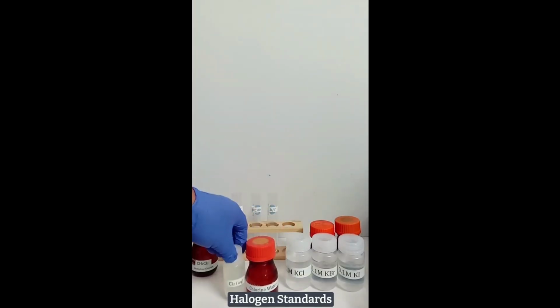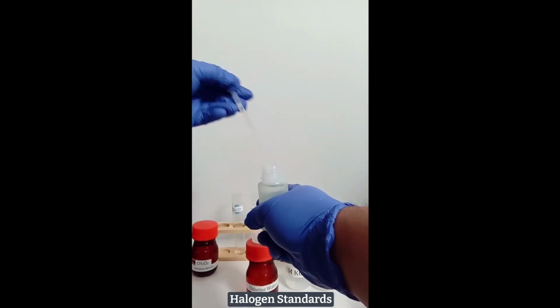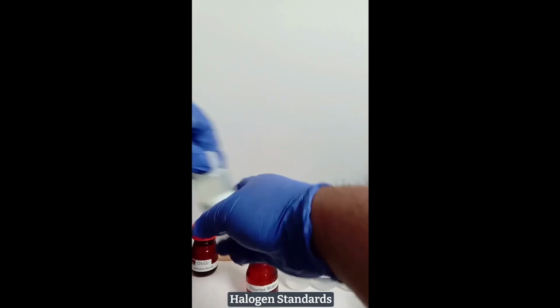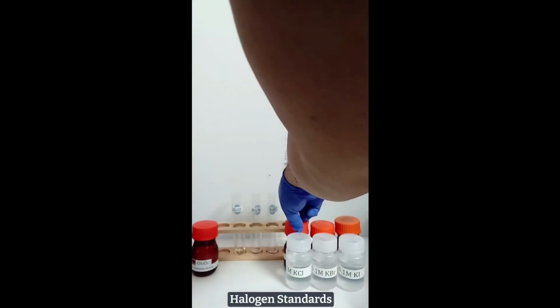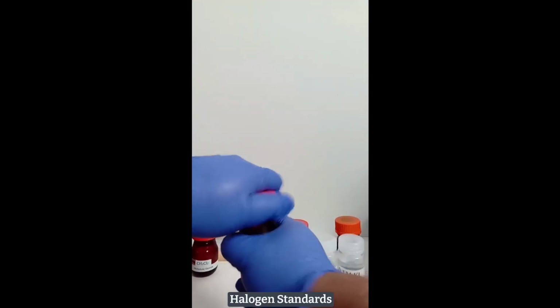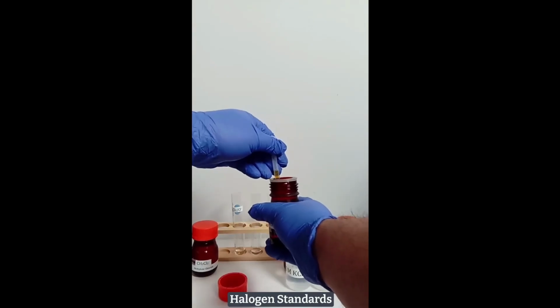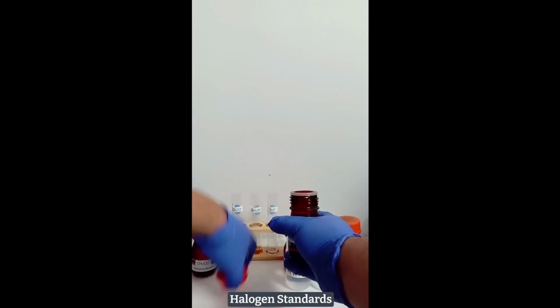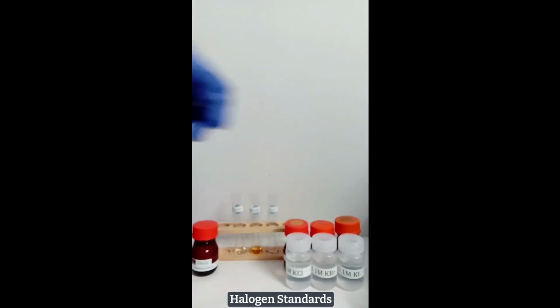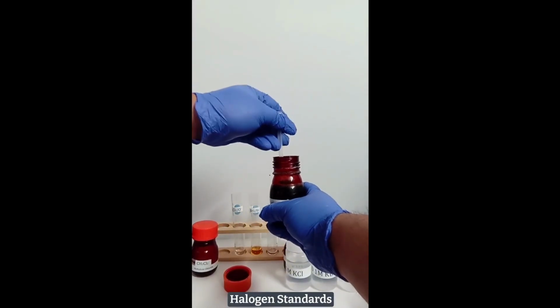Now, each test tube gets an equal volume of chlorine water in the first test tube, bromine water in the second test tube, and iodine water in potassium iodide in the third test tube.